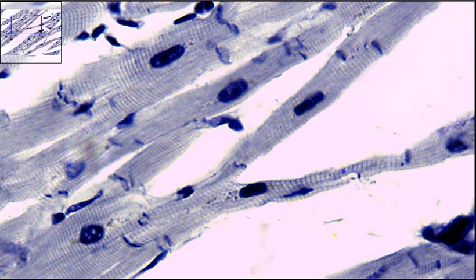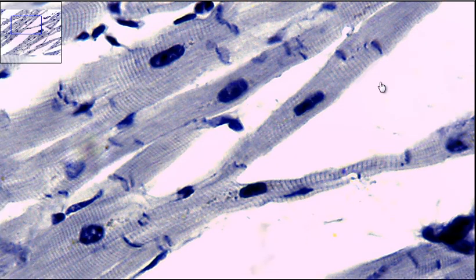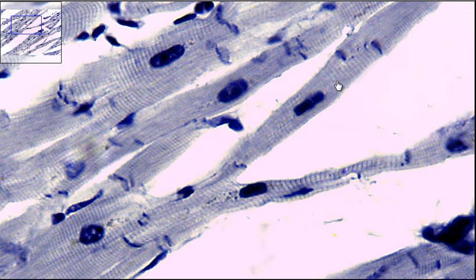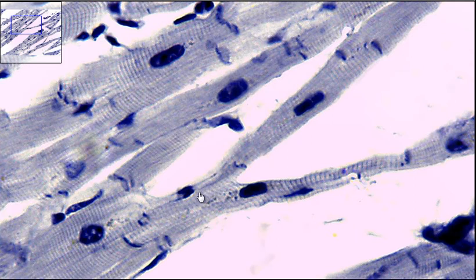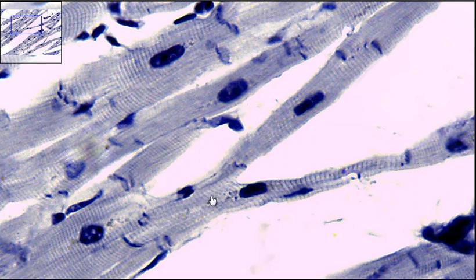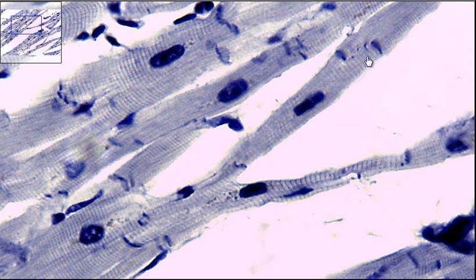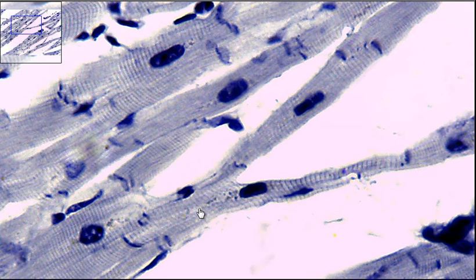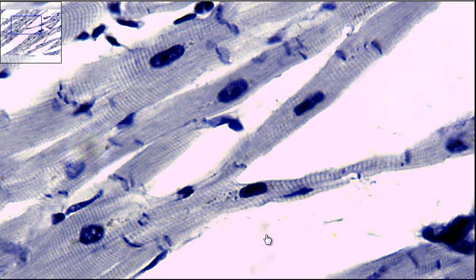We also have branching cells. At this point, you can see how this cell is breaking from one cell down here into two. So we have the branching cells in your cardiac muscle.